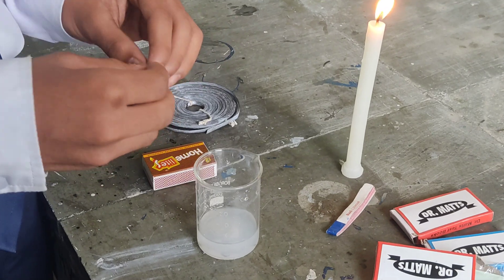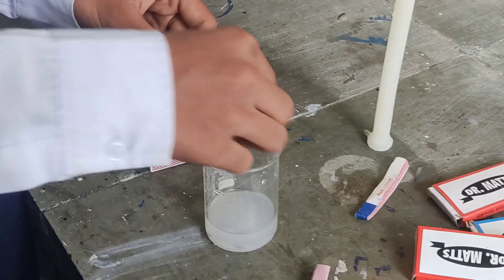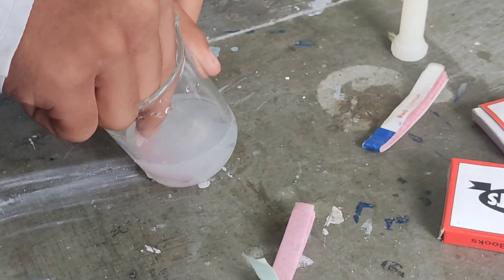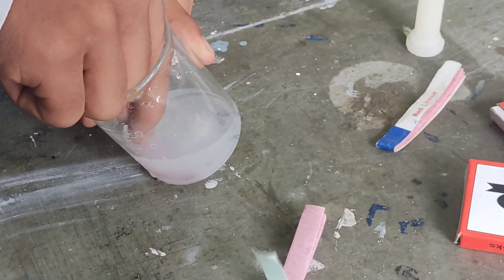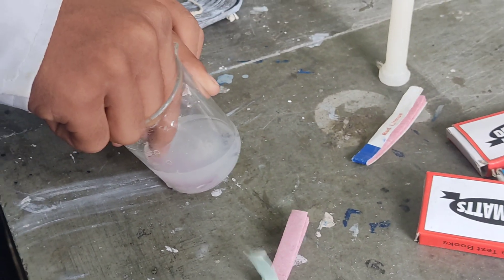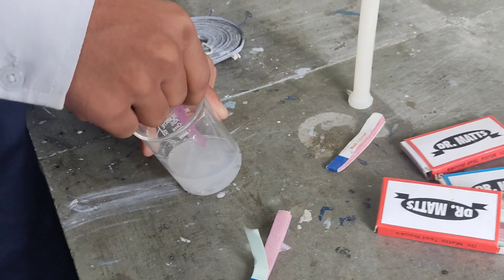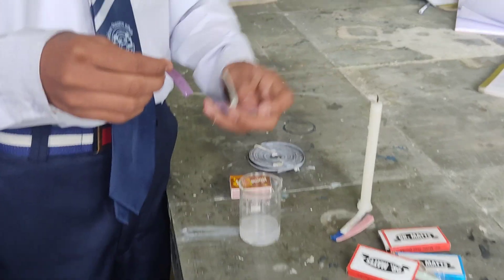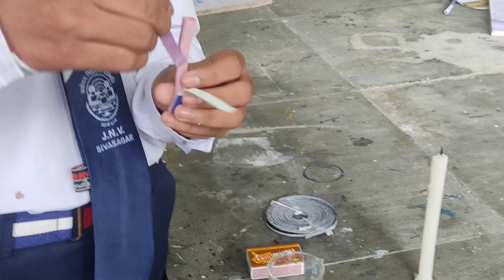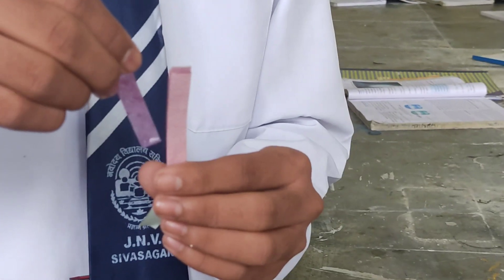To prove whether the solution is acidic or basic, Drove of class 7 is dipping a red litmus paper in this solution. Let us see what is going to happen. We can see that the red litmus paper turns blue. This proves that magnesium oxide is basic in nature. Thank you.